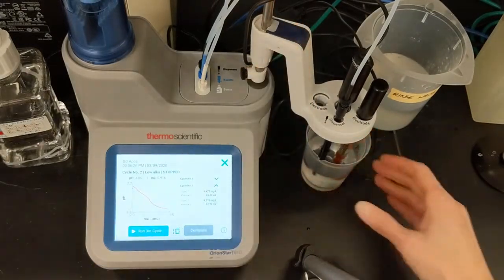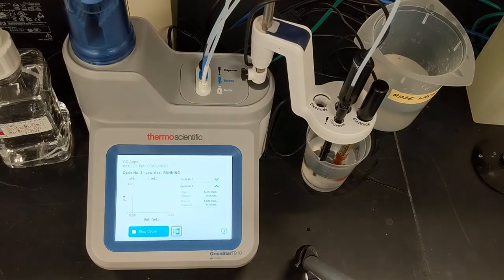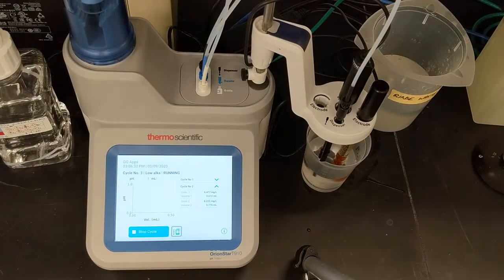I'll lower the holder into the solution and select Run Third Cycle, then Save Run to accept the 100 ml volume and run the titration.